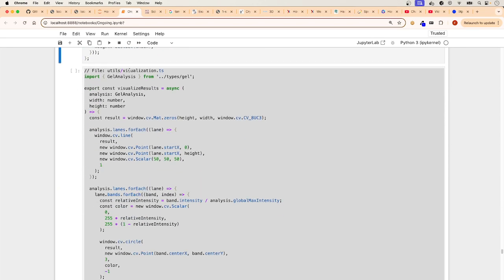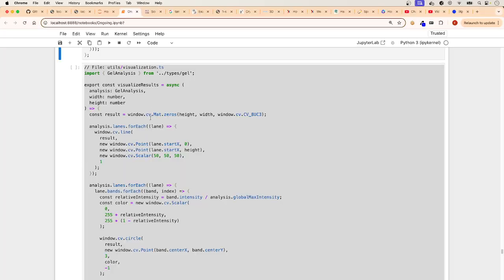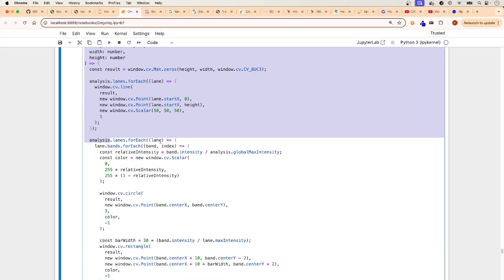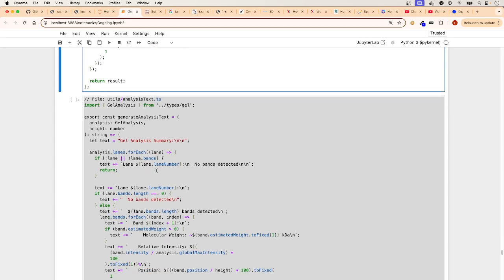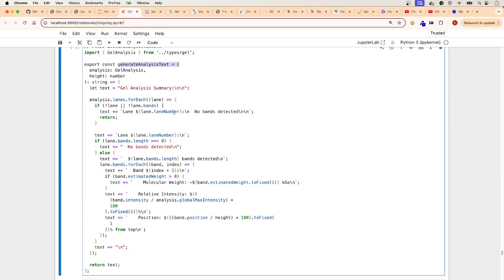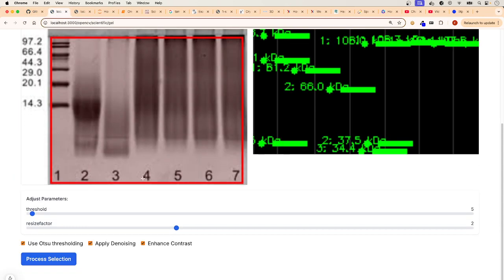Then we get into the visualization. Nothing new. It's just the same stuff that we've done in other tutorials. If you haven't watched it, go back to my other tutorials. I go more in depth into creating the rectangle, click and dragging, creating all of that. Here is the generate analysis text. All it's doing is, you are in control of this. This is basically what's happening here.